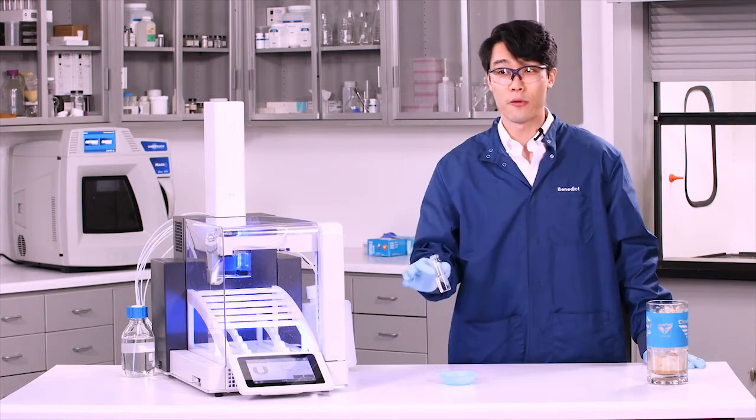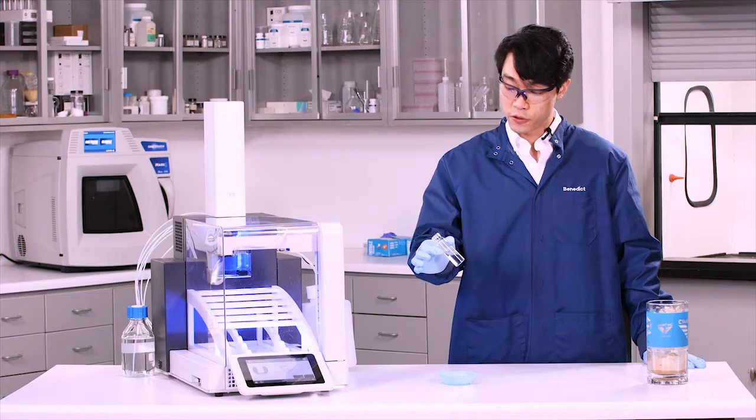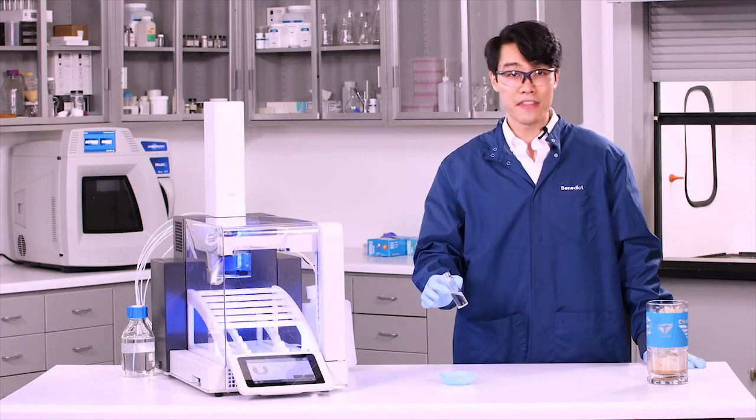Anyways, here we have our plastic extract that is nice, filtered, and cooled thanks to the Edge and that Q-disc that we put in.